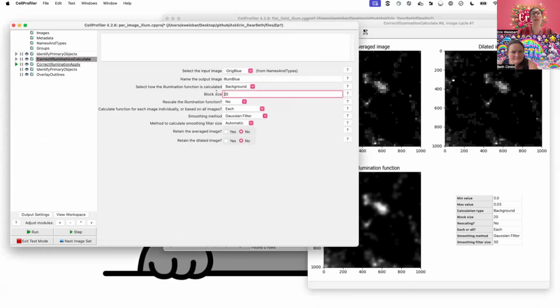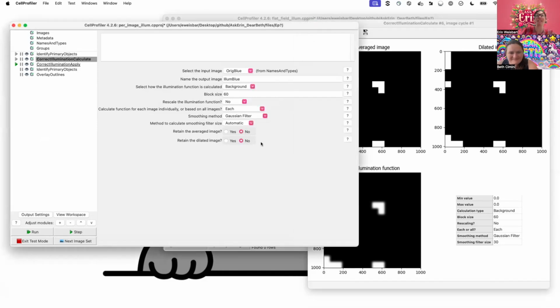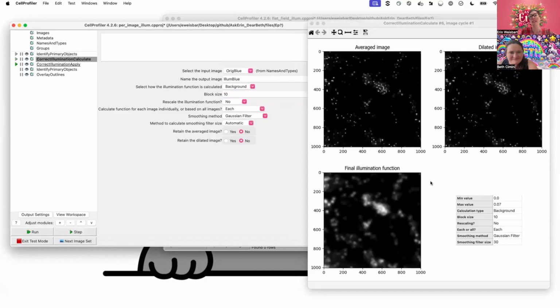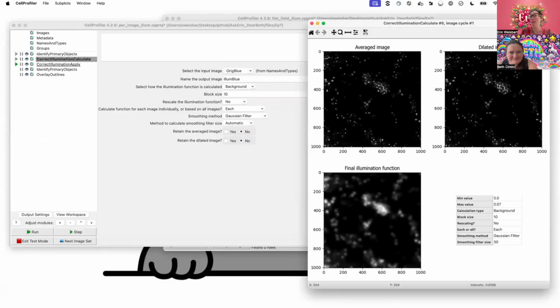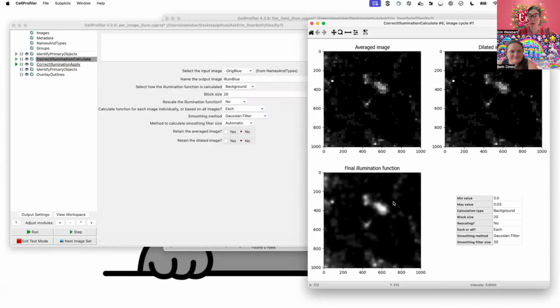And so you can play with block size. I think it started with 60. And when I did that, I looked at this output image and thought, well, that seems a little chunky to try and use to smooth out my signal. I don't think that's going to be terribly helpful. And something like this, I'm like, well, that maybe seems a little granular. Once I fuzz it out, maybe that's smoothed out enough. So some of this just comes down to empirically, what do you find, and does this help you?